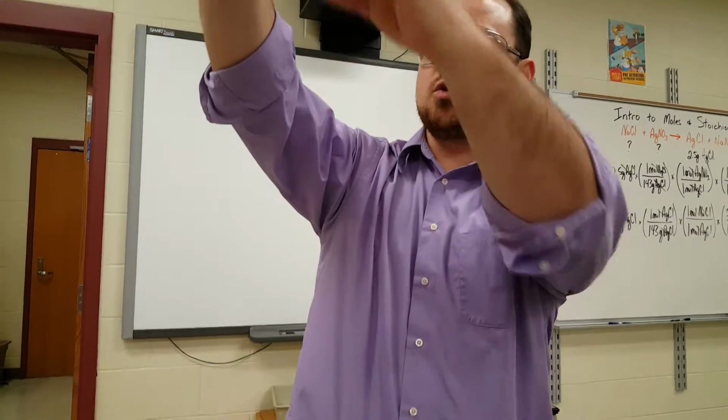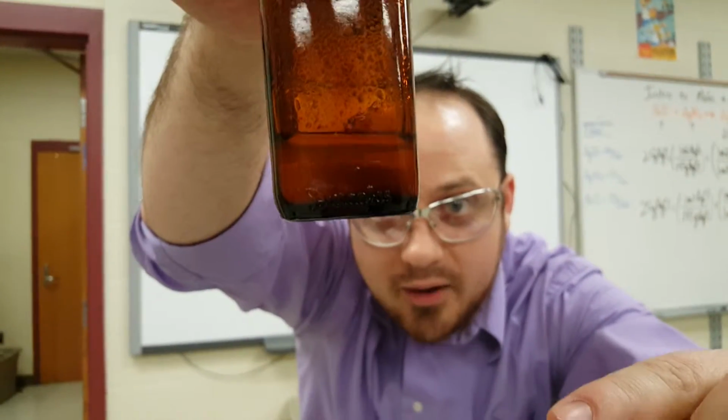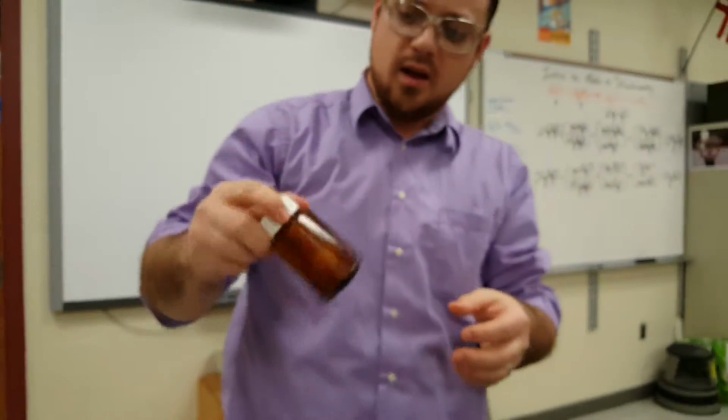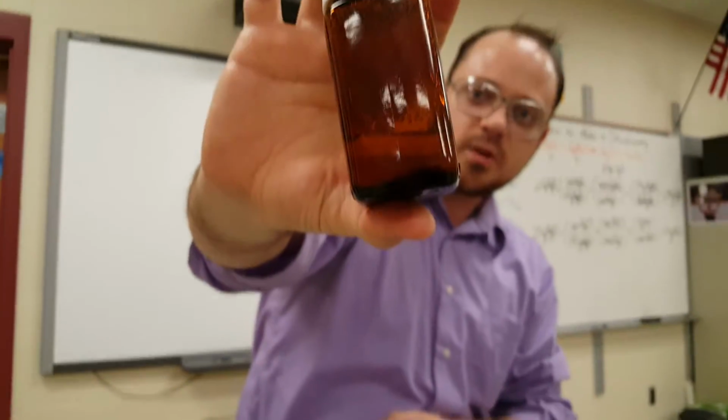So if it were to precipitate, you can actually see it falling to the bottom now. It precipitates by falling to the bottom, which is kind of the way rain falls, right? Yeah. I don't know what the true origin of that science term is, but I got the sludge.